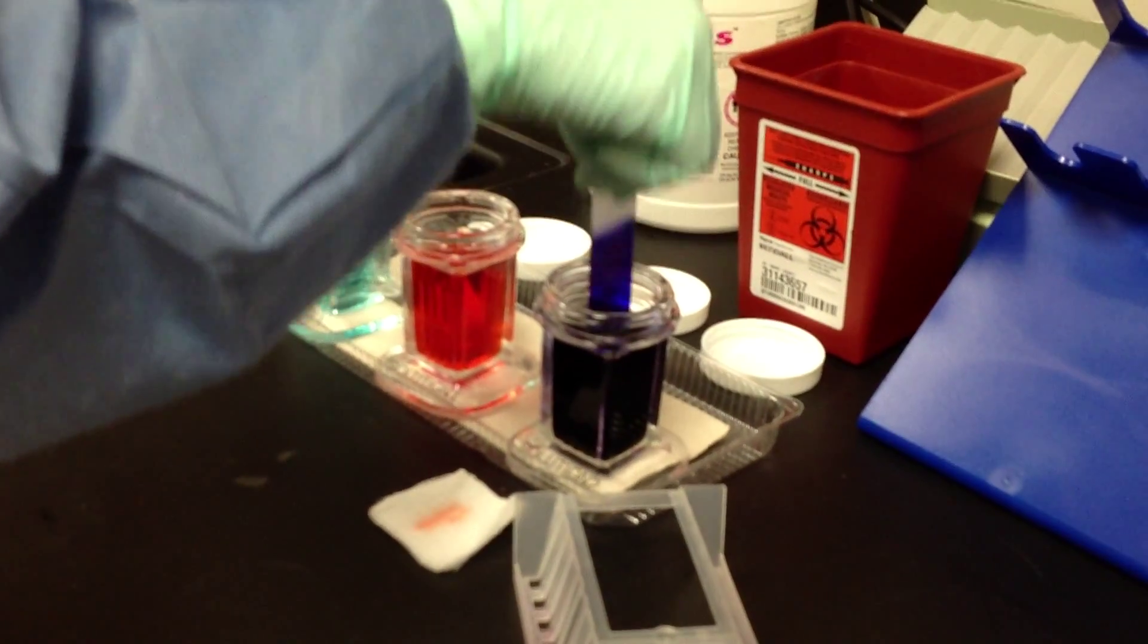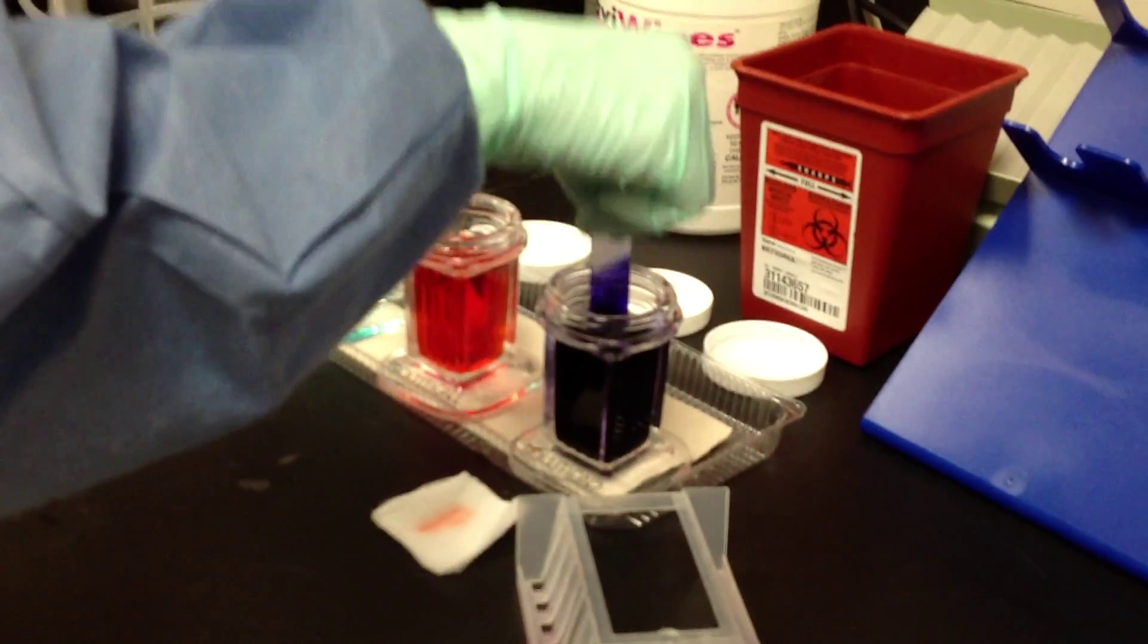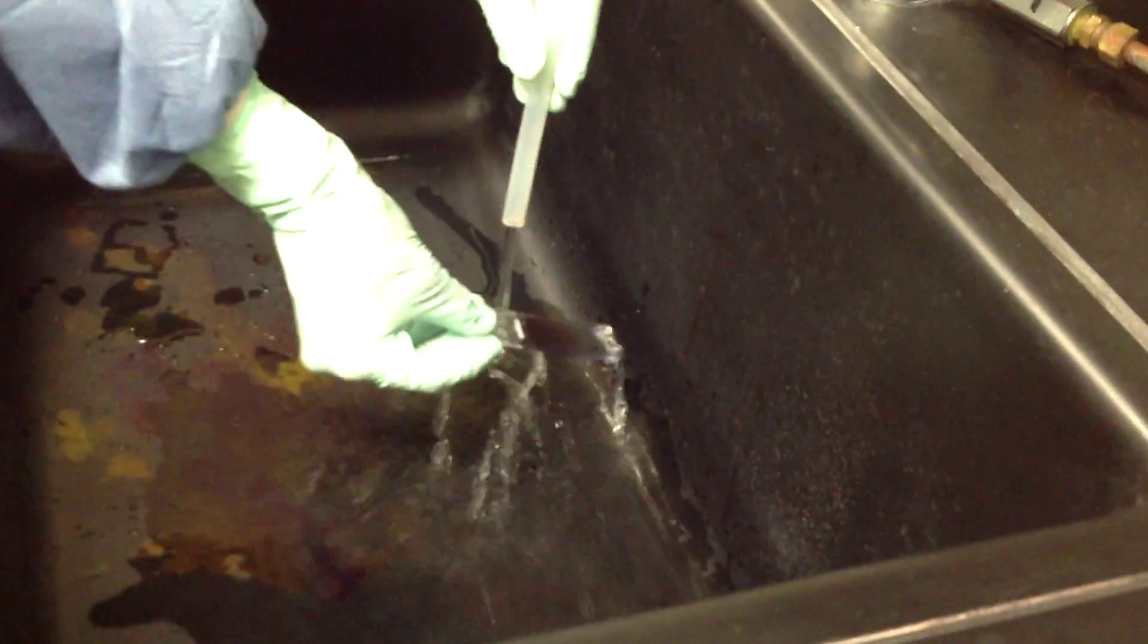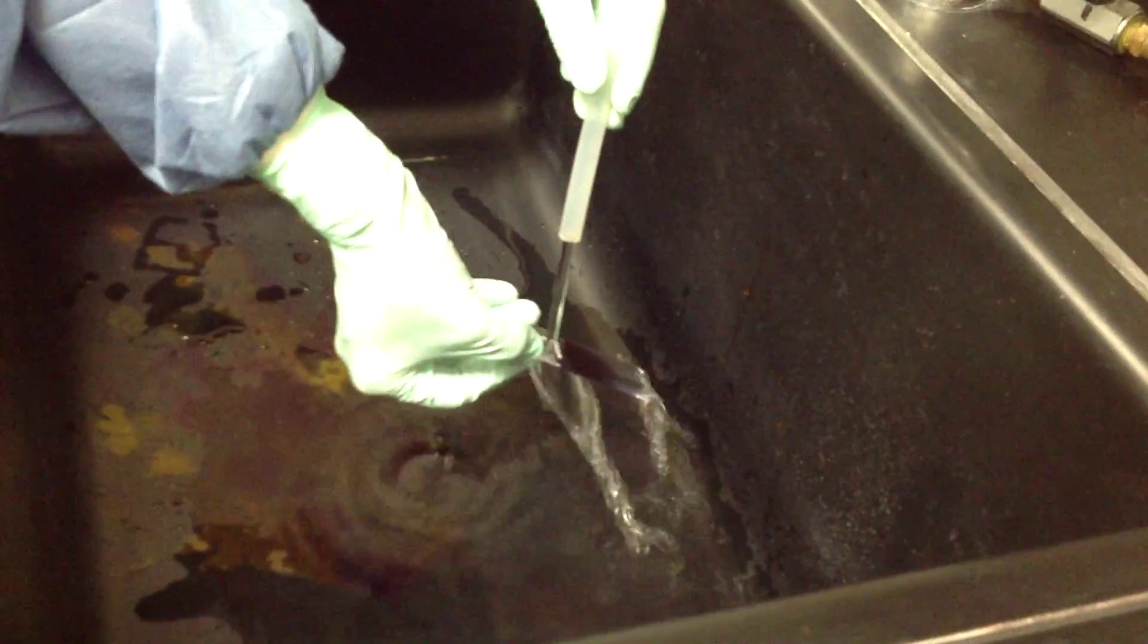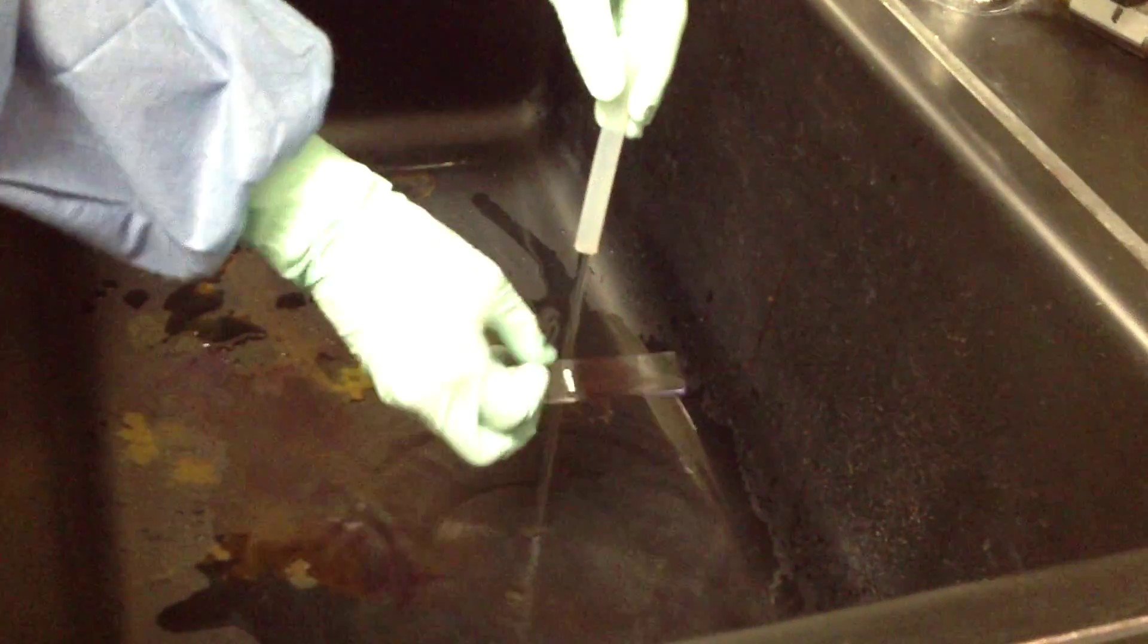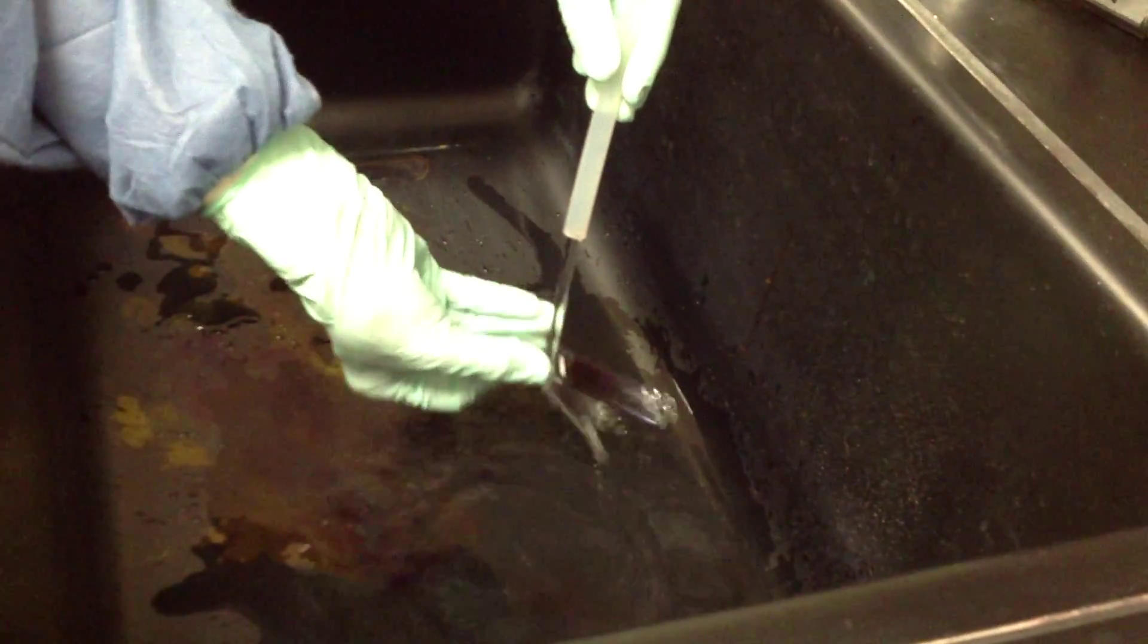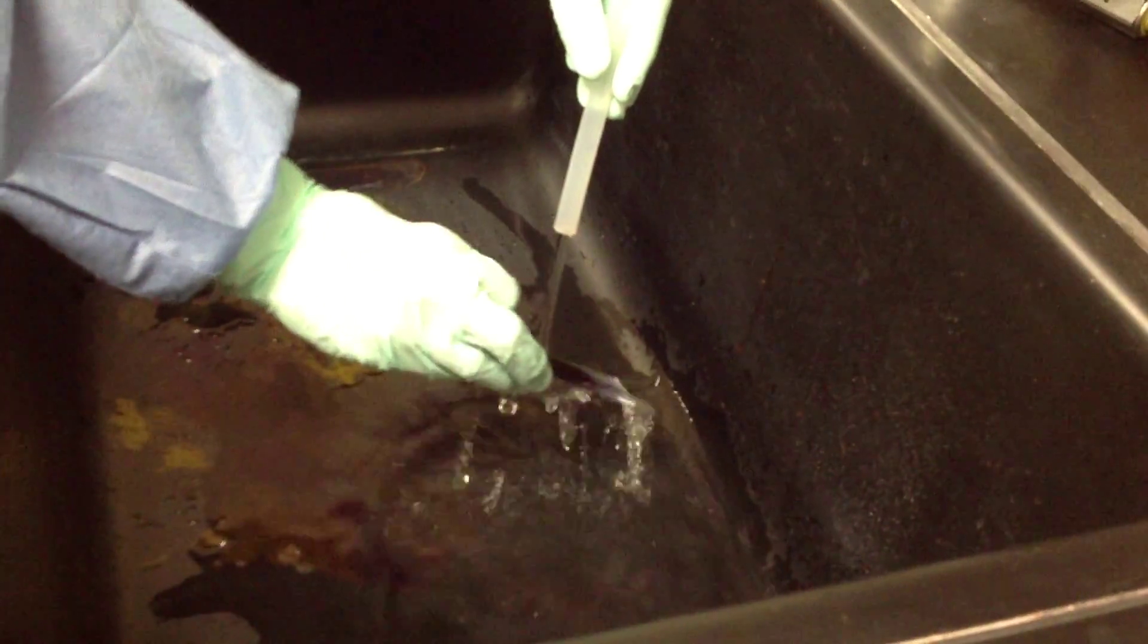Immediately after the fifth dip, she's going to take it over to the sink and hold it under the stream of water, backside against the water. Briefly flip it over to the blood surface to rinse all areas well until the water runs clear.